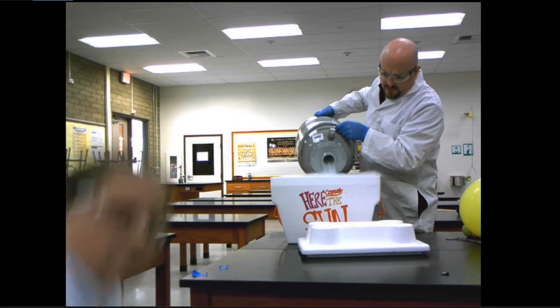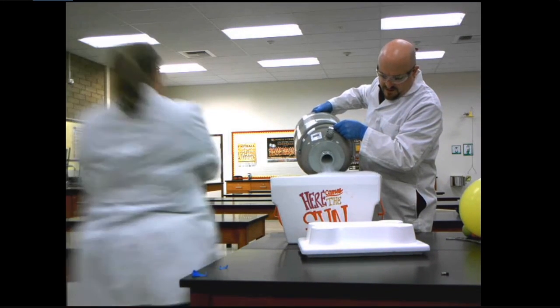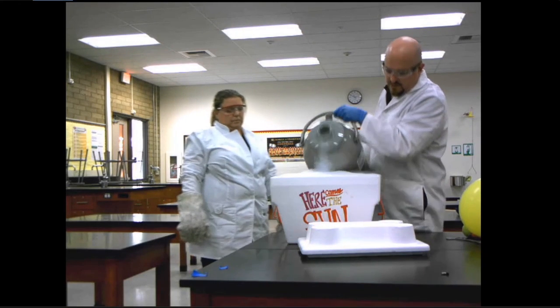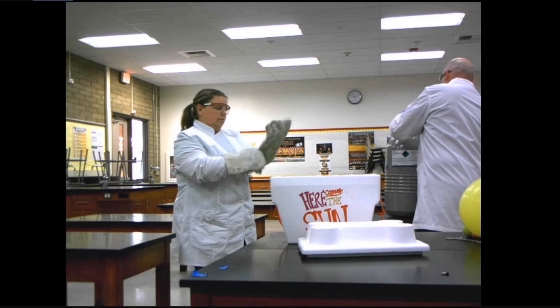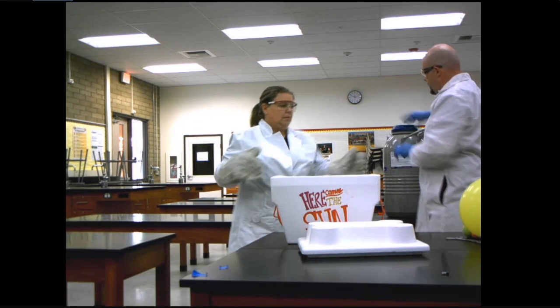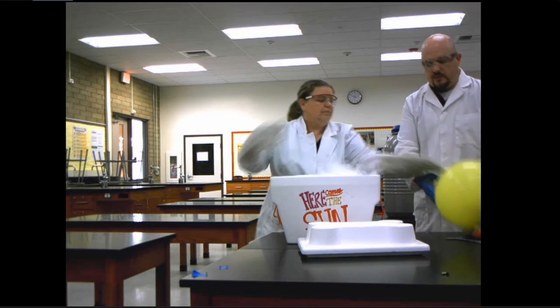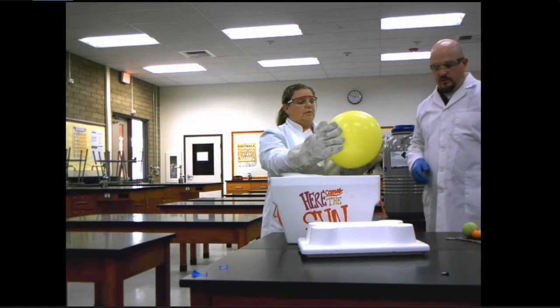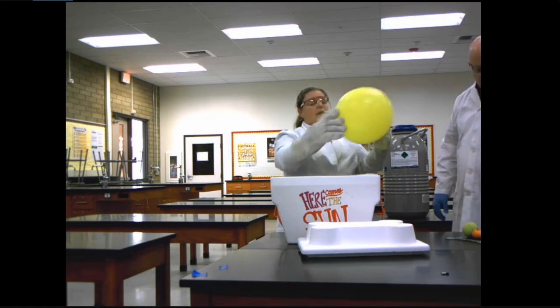And then run some experiments with this. Okay, this is not dry ice. Maybe you have some experience with that. But nonetheless is very cold. Okay, so there's Ms. von Volkenberg with the balloon. Yep. Take it away. All right, so we have this balloon.